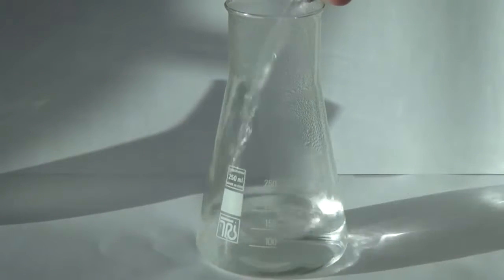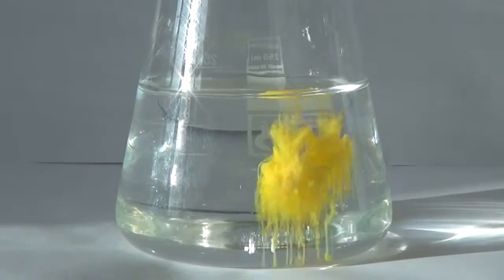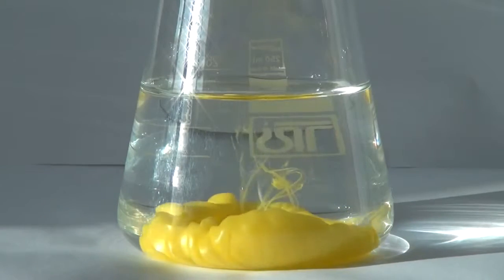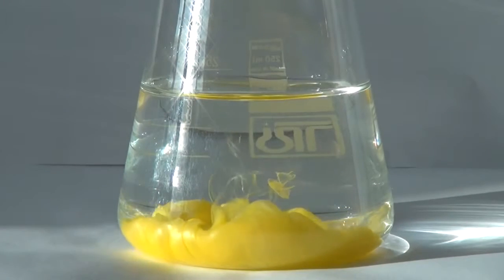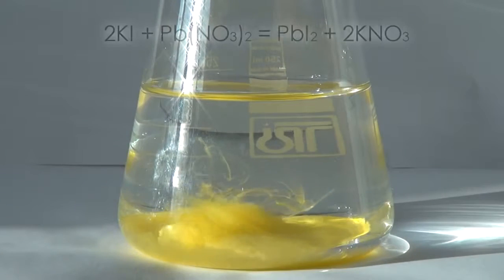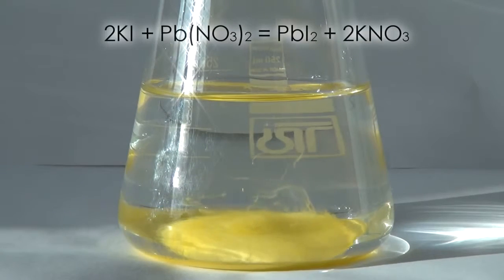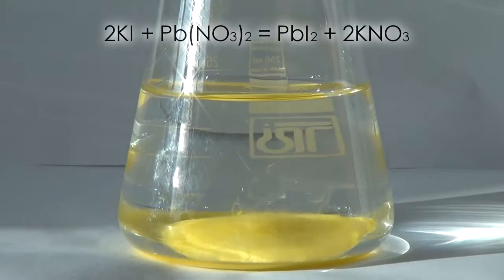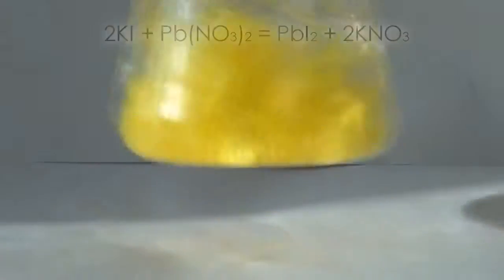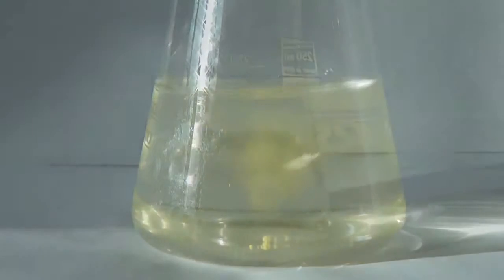Once everything is dissolved, take a large beaker and merge back our solutions. If the solutions were cold, then a fine precipitate is going to form from lead iodide. However, our solution is hot, and a precipitate of lead iodide will dissolve in the hot water.